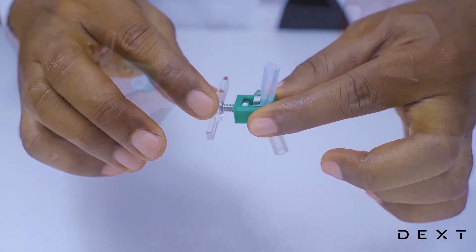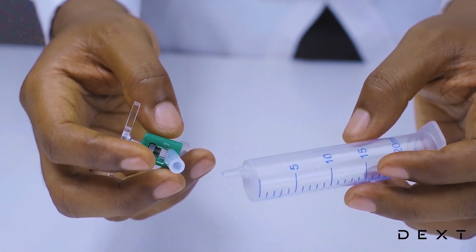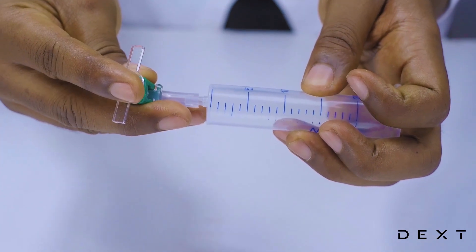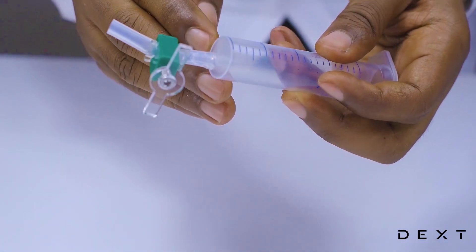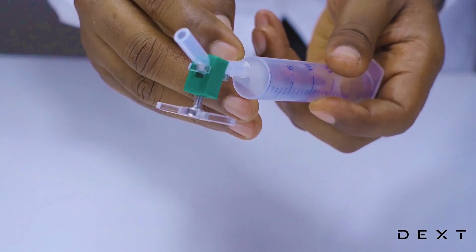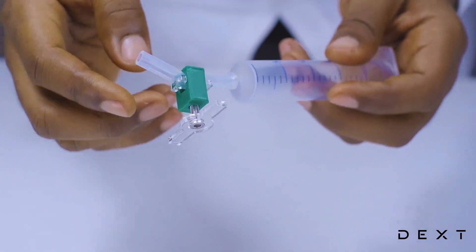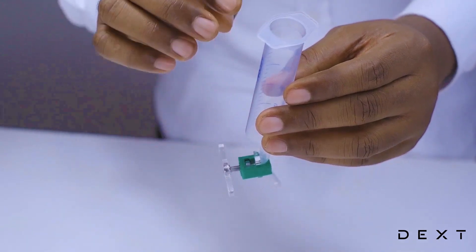Make sure to not go too much in order not to break your plastic piece. The next thing we will do would be to place our silicon tube onto the barrel. Make sure there is no gap between the silicon tube and the barrel. Make sure it is nice and flush.